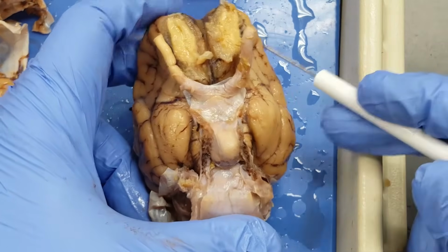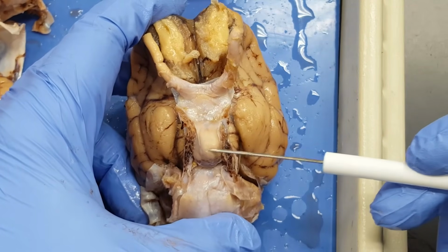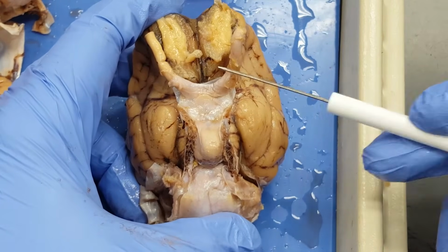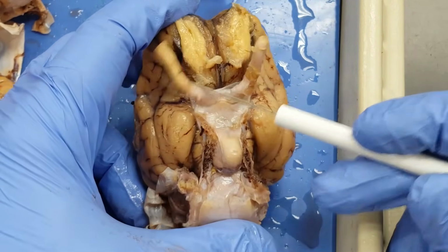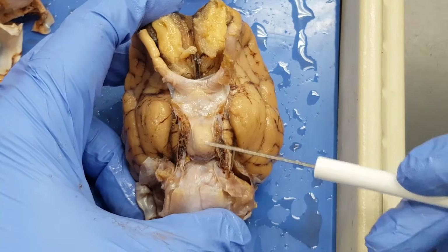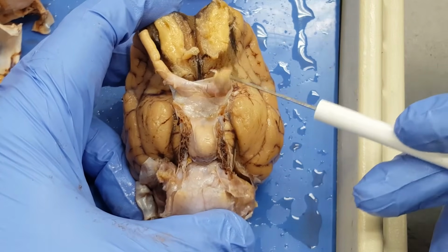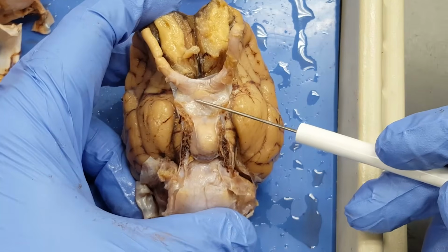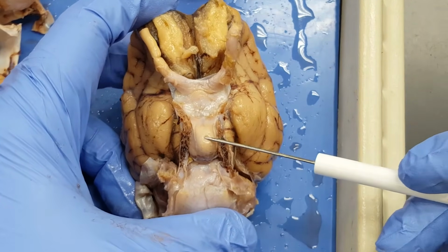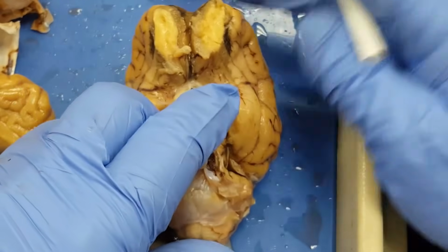So a couple prominent features I can see on the bottom of this brain. This structure right here is the pituitary gland, directly behind, look at this everybody, optic nerves, optic chiasma, right there, so right behind it is the pituitary gland. So I've got optic chiasma right there, pituitary gland right here, and then watch what happens if I fold these optic nerves down.